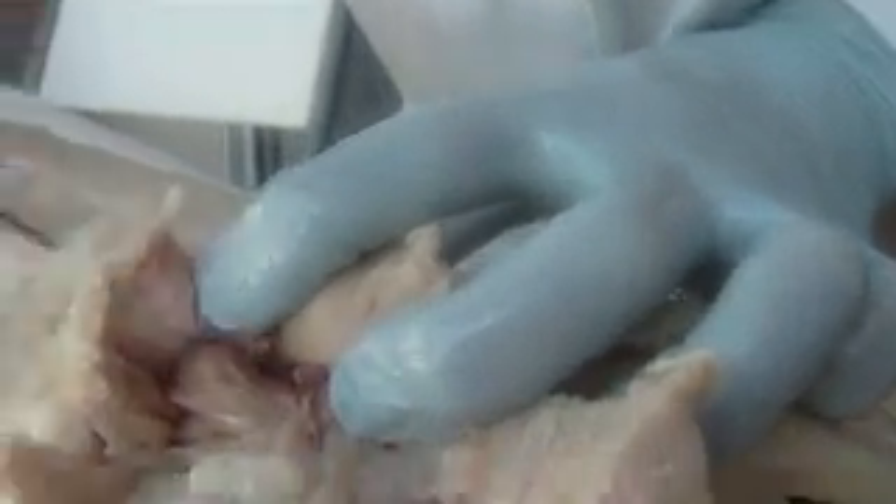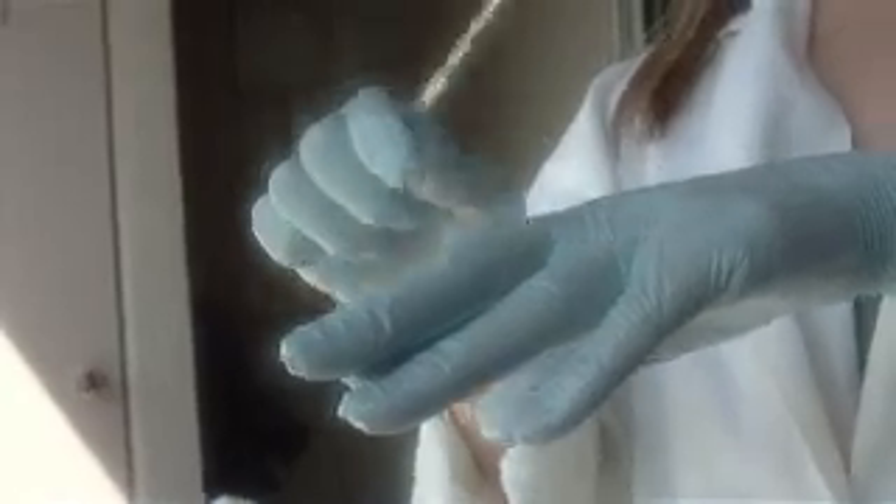Piriformis — 'Good Grief Please...' Now, the first three muscles are layered like this: gemella superioris comes over top of the other two — that's why it's superior, because it's on top. You have piriformis on one side and gluteus minimus on the other, with gemella superioris on top. The size of gemella superioris is different on every cat because when we pulled up the gluteus medius it took some of it off — sometimes it's just a tiny strip, sometimes it completely covers the piriformis.